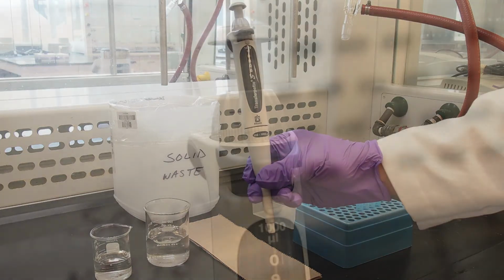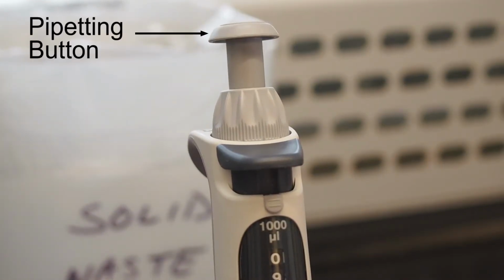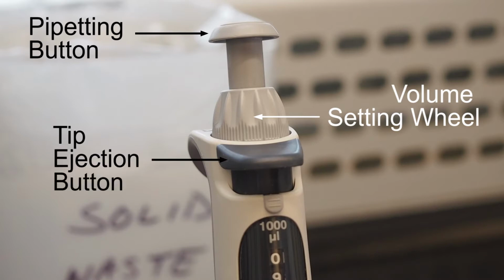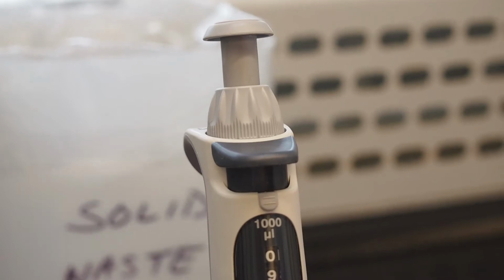Let's now go over the main components of a micropipette. We have the pipetting button, which is used to draw and expel liquid. There is a volume setting wheel to adjust the volume required for the transfer, a tip ejection button, a volume change protection button, and the volume display window.